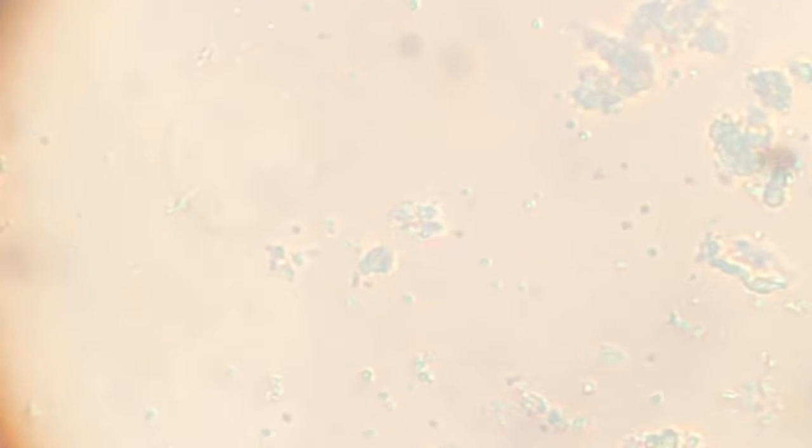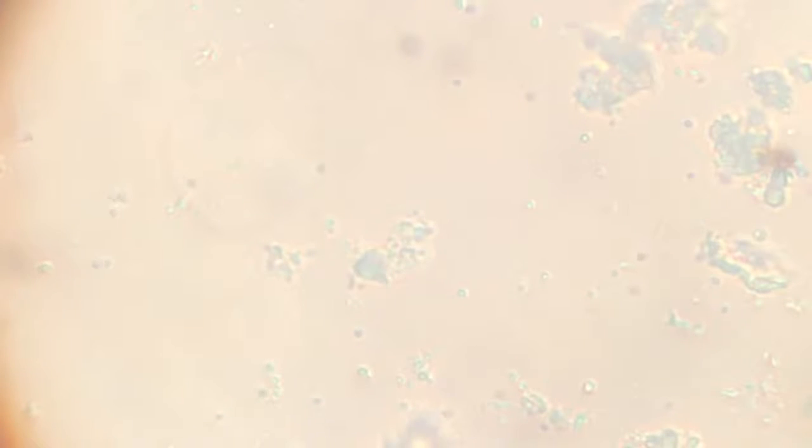It is now converted into a kind of a blob, just a small blob. I don't know, somehow there is something with the camera today. But there it is, right in the center.